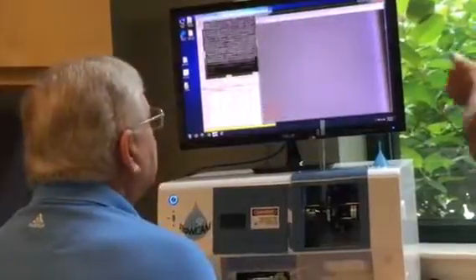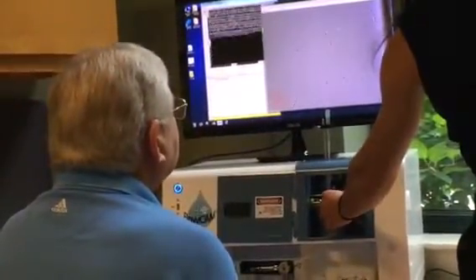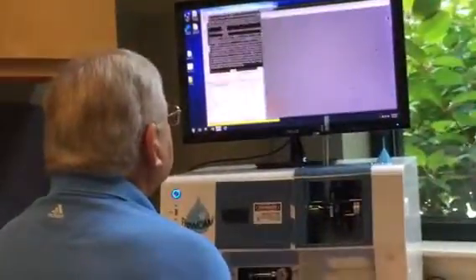Oh, and look, you can see how I knocked the edge of the flow cell into view. Right. So I want to actually bring it back using my XY knob. And you did that while you were focusing. Yeah, I probably just bumped it.